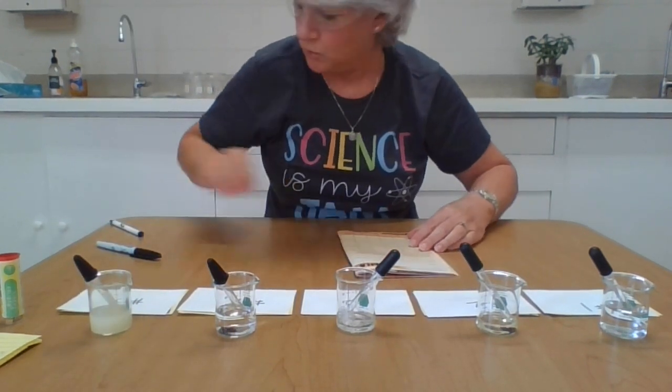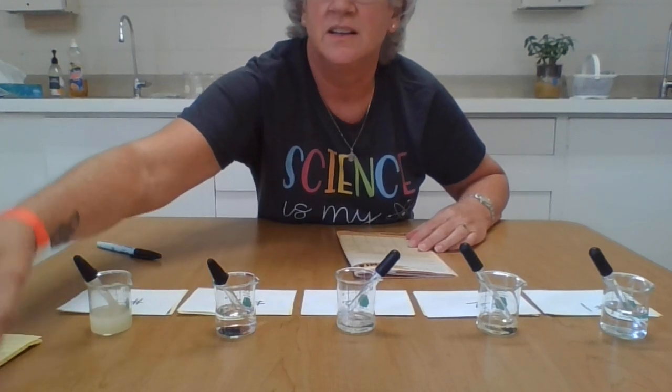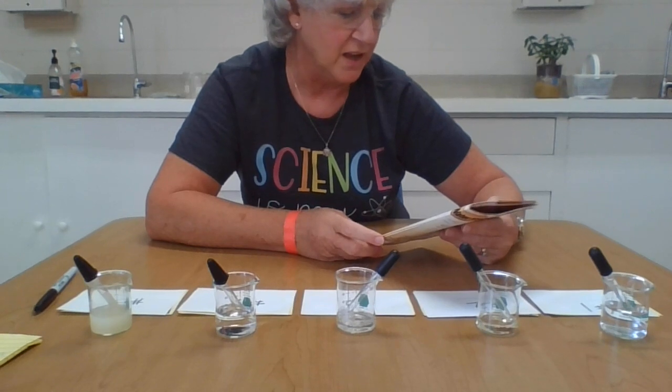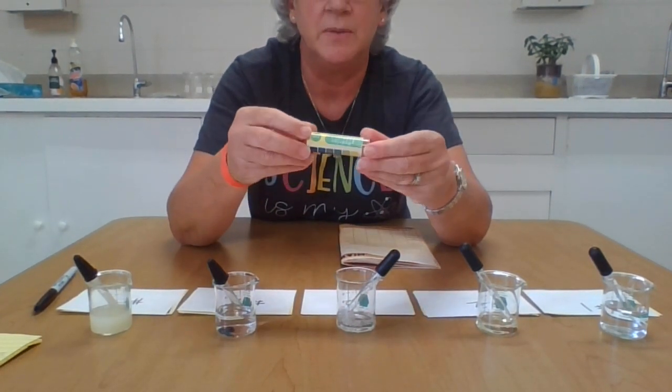So you should have recorded those characteristics of each of the mystery liquids in your chart on page 18 of your LearnEd notebook. Now we're going to talk about litmus paper. This is litmus paper, or Hydrion paper.